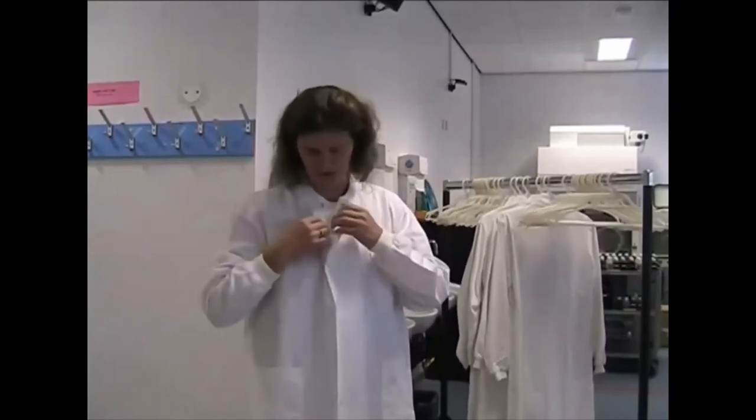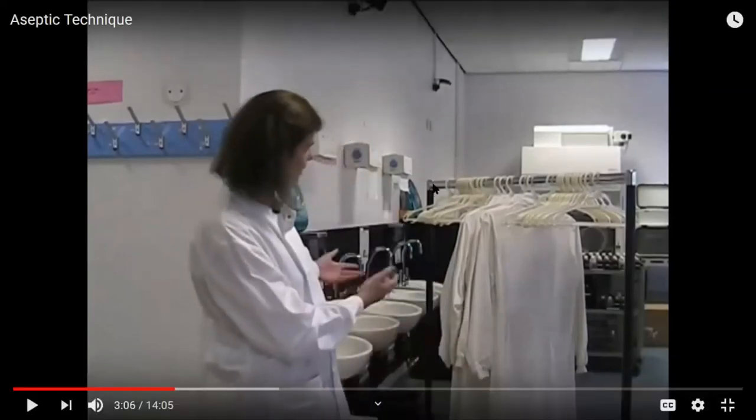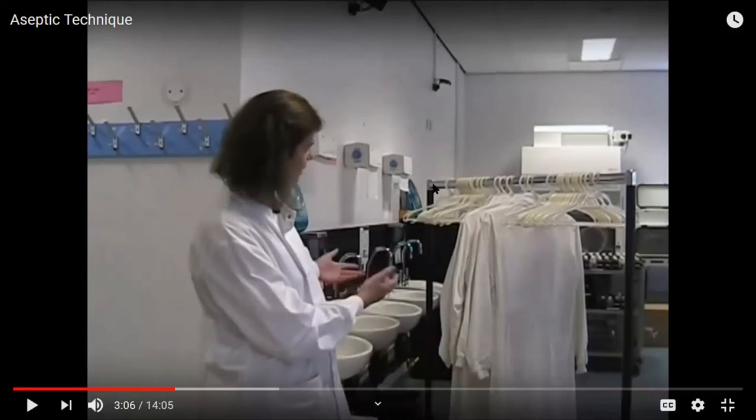In microbiology labs, lab coats have elastic around the arms and tie up to the neck and the front. You must never bring food or drink into the lab — no chewing gum, no fingers or pens in your mouth. If you spill anything on your hands, wash and disinfect them before continuing. In addition to the lab coat, you're also required to wear long pants and closed-toe shoes in the lab.